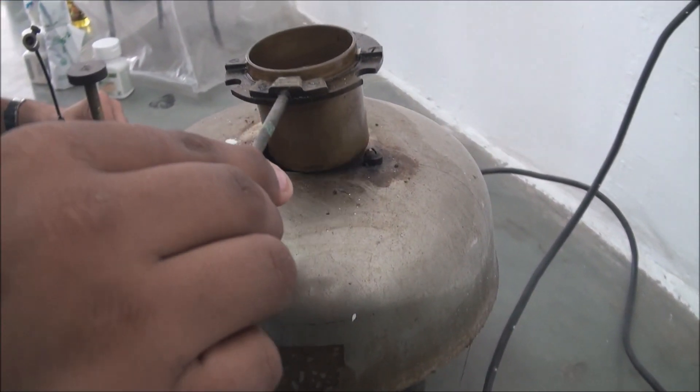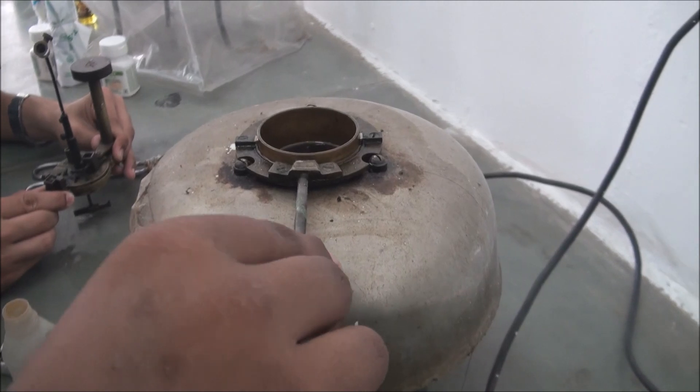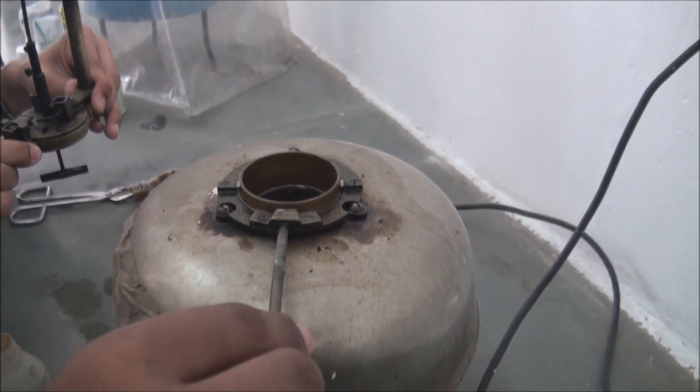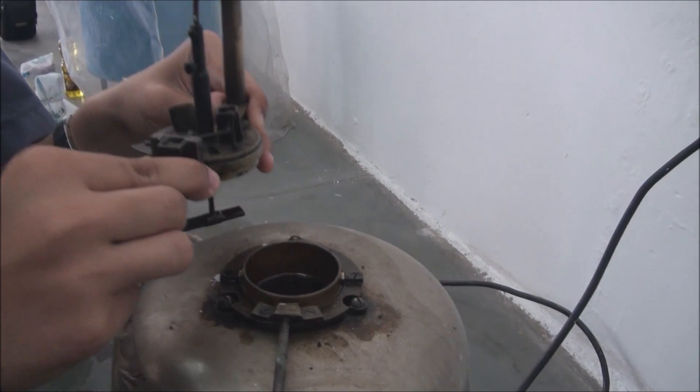To fix the apparatus back in its position, the container should be adjusted according to the grooves. Also, the upper lid can also be fixed by the grooves provided.